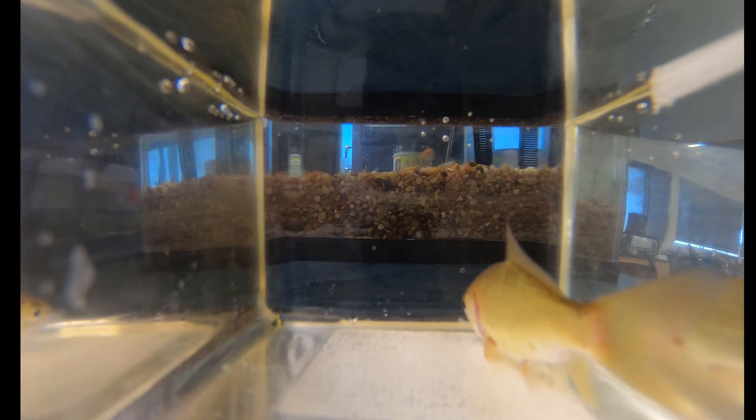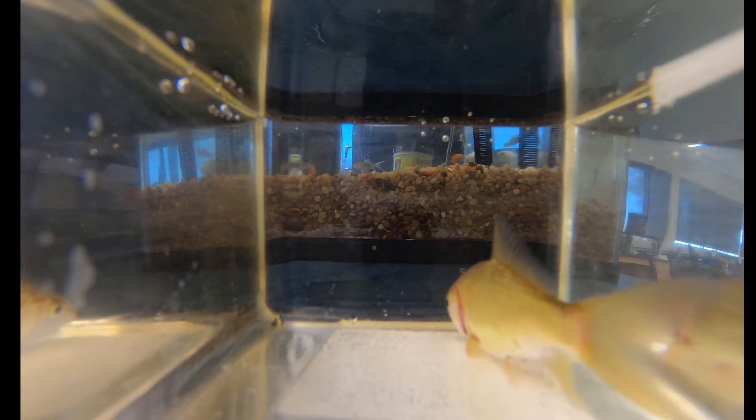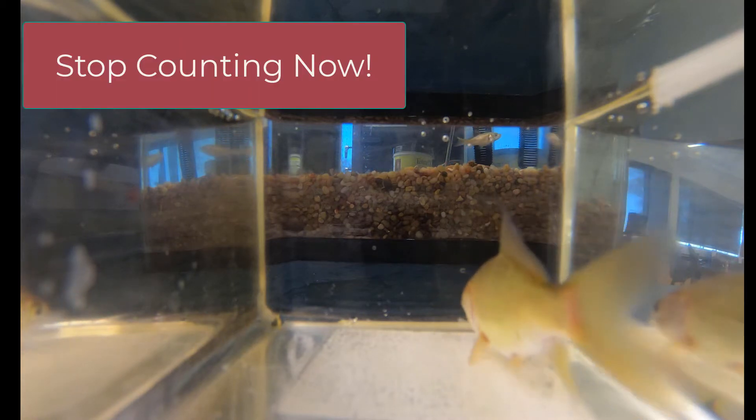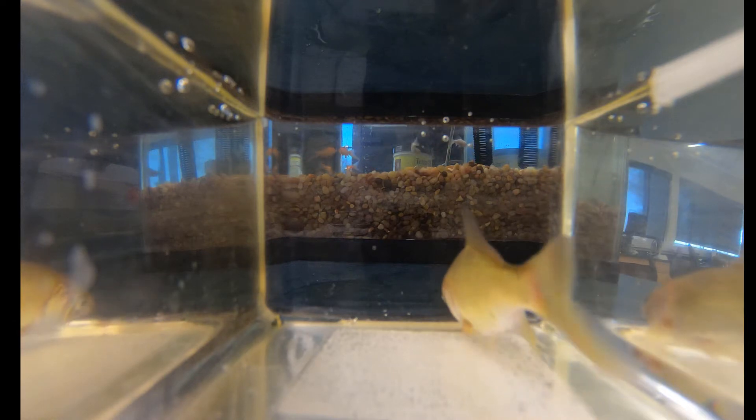And stop — that's the end of round one. Now we'll do trial number two — start counting now. Trial number two only lasted 15 seconds, so you'll need to multiply your count by four to get the number of operculum movements in one minute. Now we'll do room temperature trial number three.